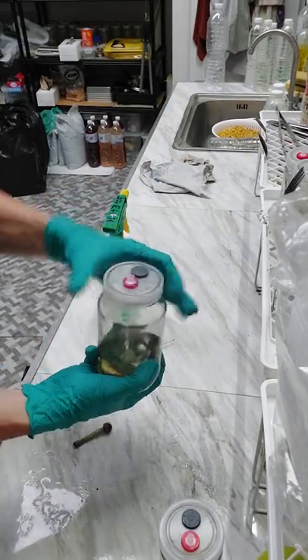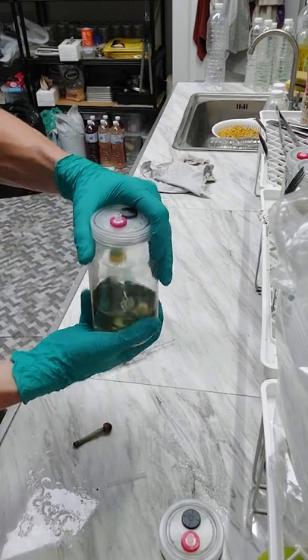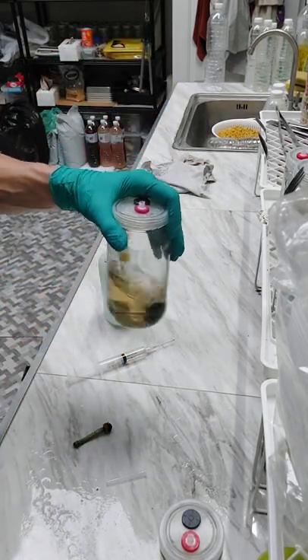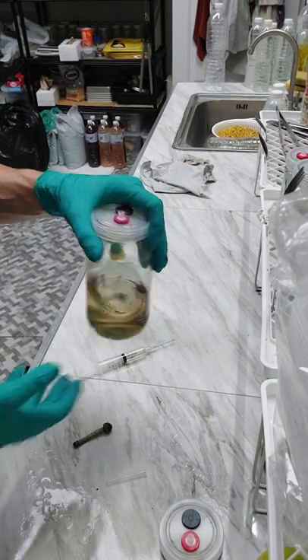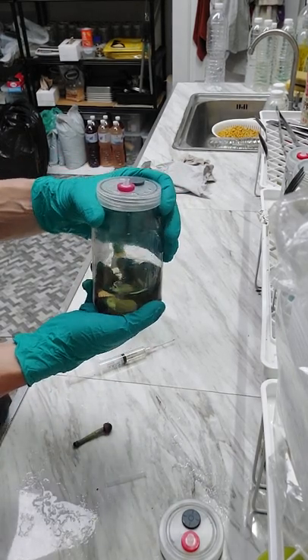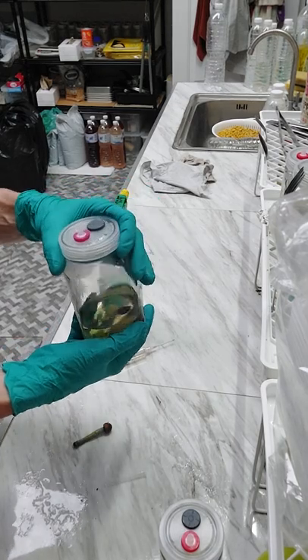If you don't do this — don't go up and down, just vibrate. I've got marbles in there; a stir bar or whatever you want to do works too. This doesn't take much, but do this maybe in the first couple days — probably two or three times a day if you can remember to do it.